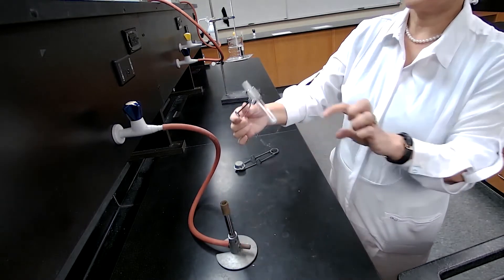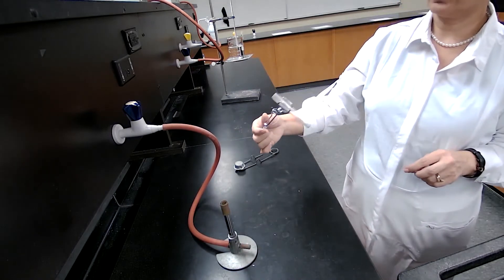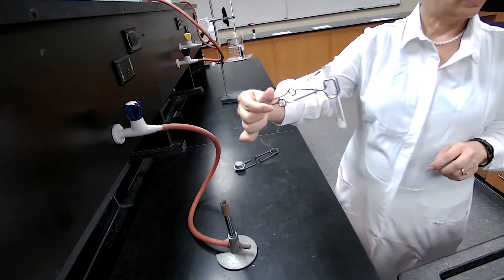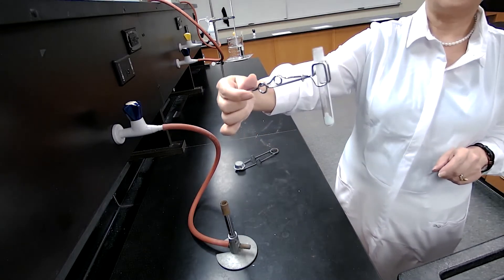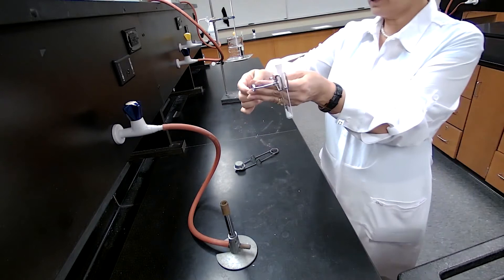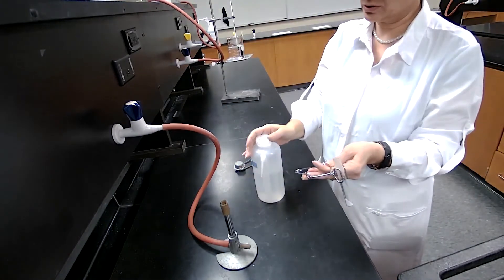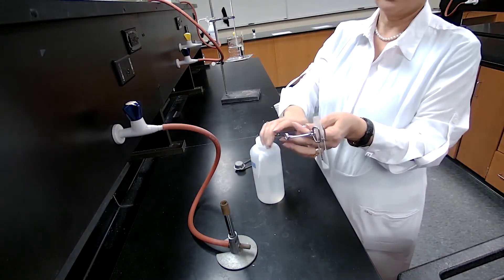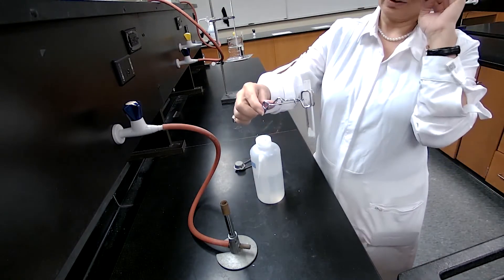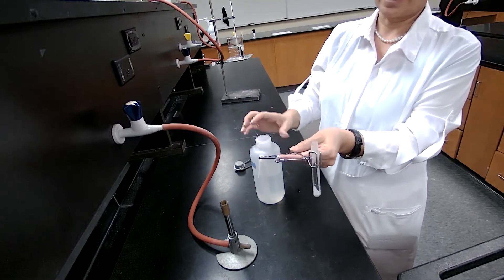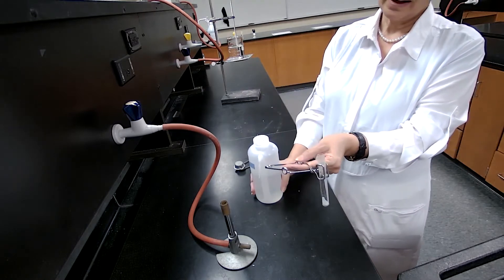After this, the test tube cools off, it cools down to room temperature. I'm going to add a drop of water. Following the procedure, we always follow the procedure. That's why I want you to read the procedure before you even watch the video, because it makes more sense.